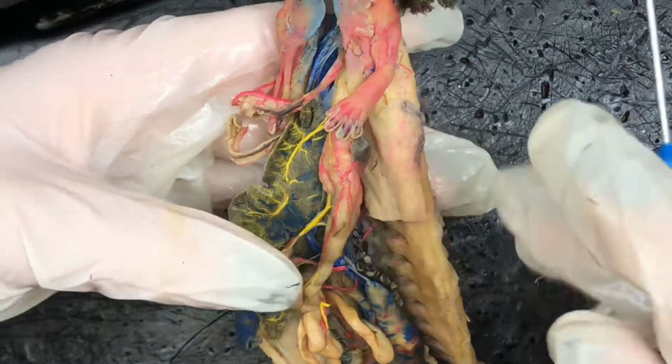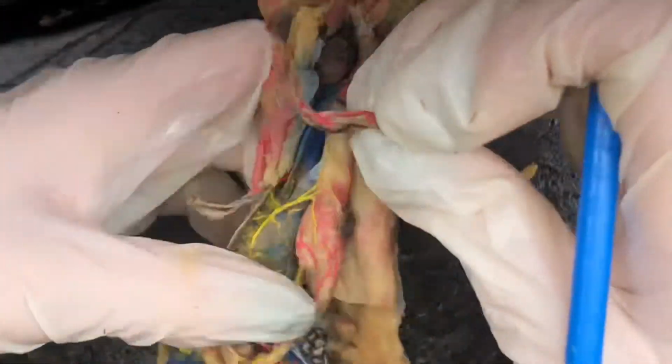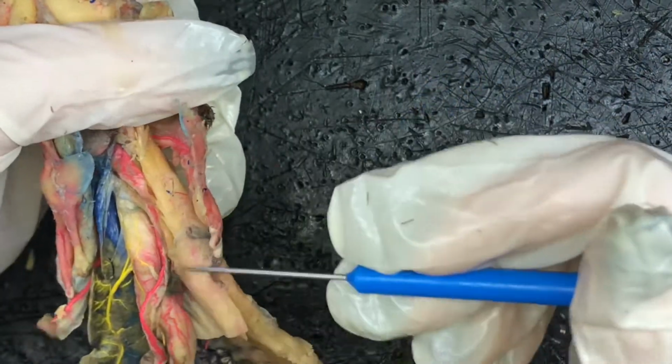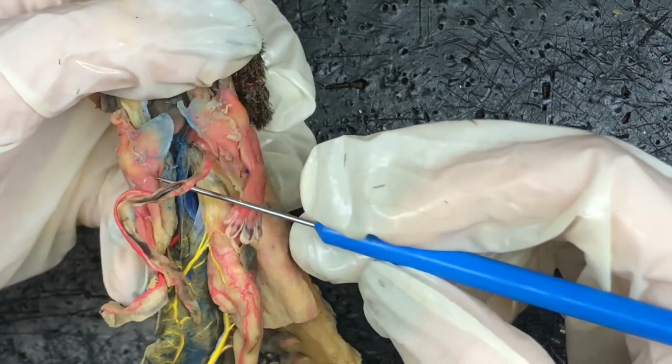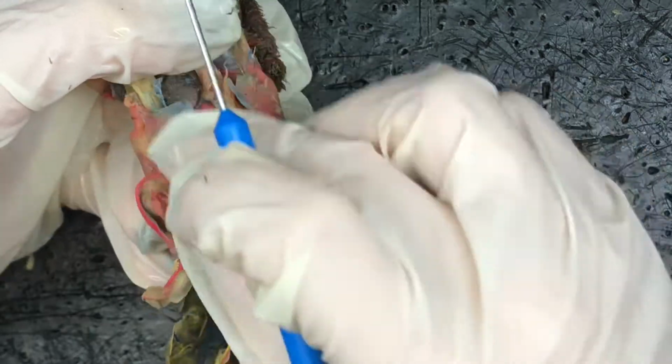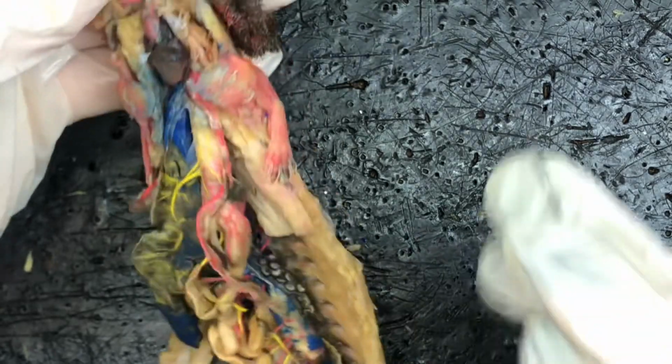And that should be everything that you need to know. Oh, we also have the pulmonary artery and vein, which runs in the lungs. So we have our lungs, the artery, and the vein is a little bit harder to see in this, but it's the little dark sections. But we do have the pulmonary artery and vein in the lungs. And that should be everything that you guys need to know for the circulatory system of the Necturus.